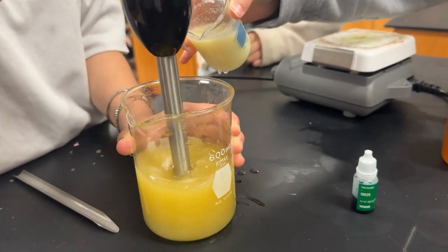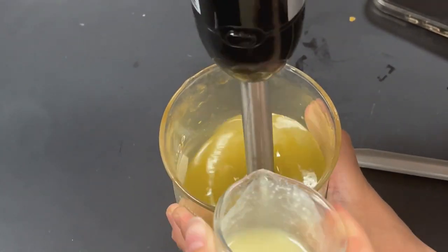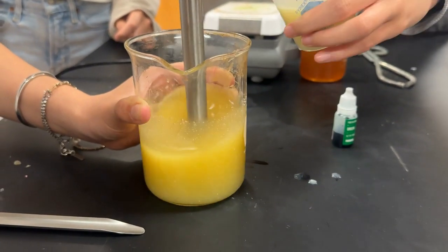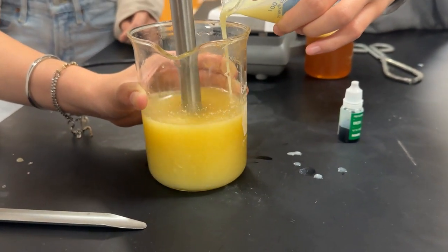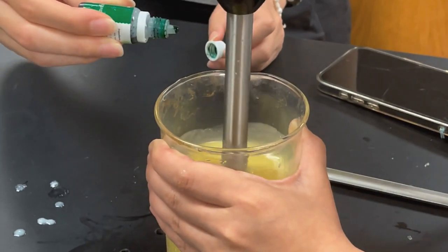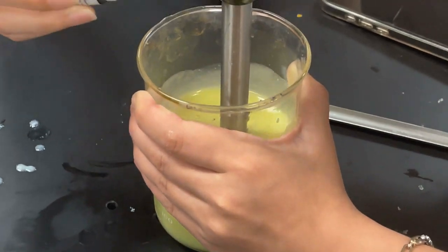Once both mixtures are ready, take an emulsifier and place it in the oil mixture. Slowly add in the milk and lye mixture until everything is mixed evenly. You can also add in food coloring if you want, but be aware that the color seen in the mixture won't be the same color you see once the soap is hardened.